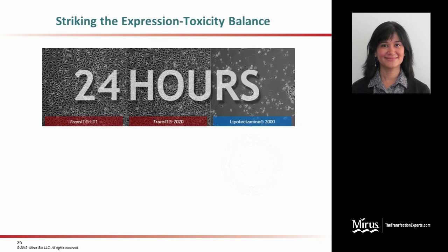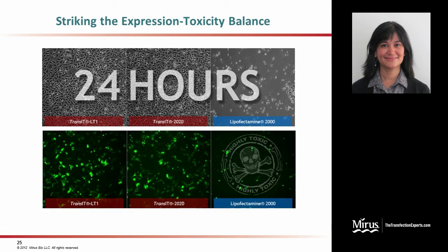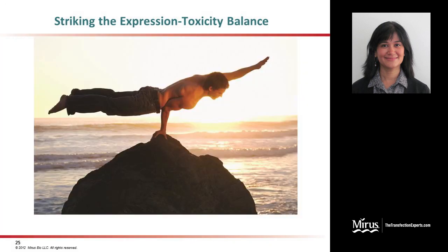However, as you progress into the 24-hour time point post-transfection, the lipofectamine 2000 formulation wreaks havoc on the cells. The cells are all shriveled up and rounded compared to the healthy-looking cells with the Transit LT1 and Transit 2020 formulations. This also correlates with the GFP expression profile because the cells that are rounded up and shriveled, even though they might be expressing some GFP, are essentially lost during transfection. This drives home the point that striking the balance between expression and toxicity is really critical for your transfection experiments.